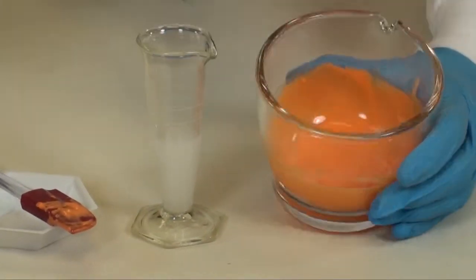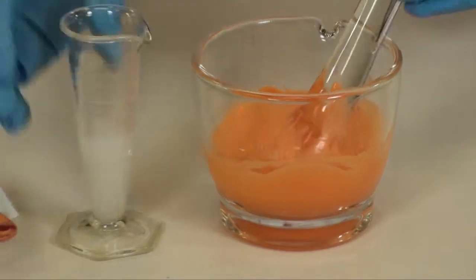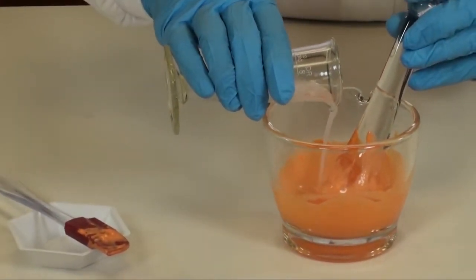Once you have a smooth slurry, you can geometrically add the remainder of your ORA Plus more quickly.